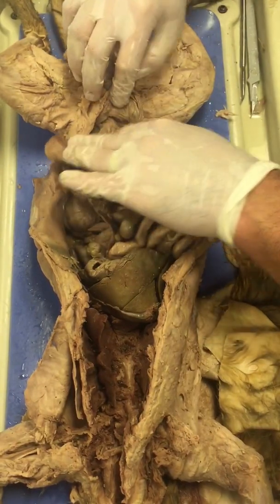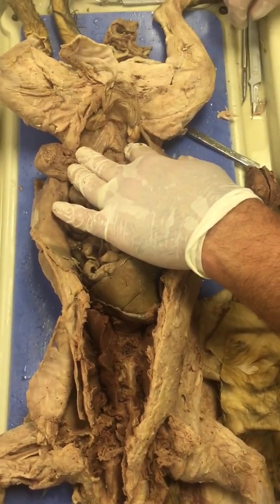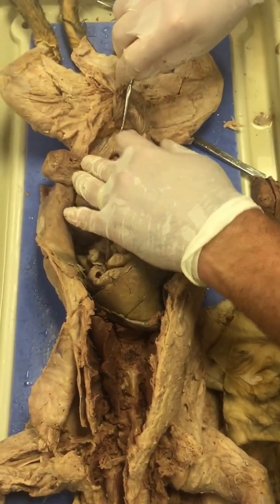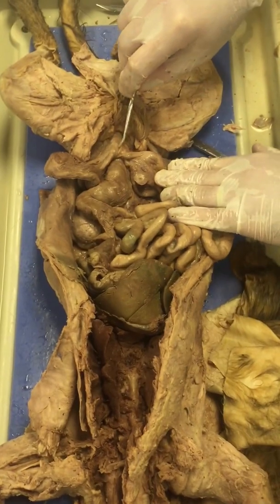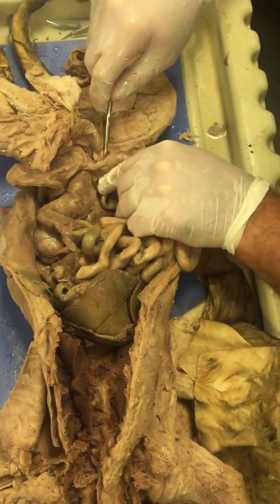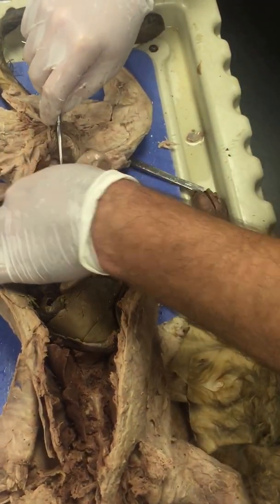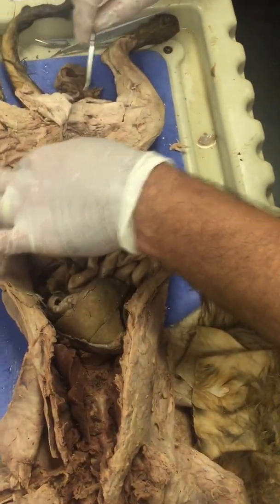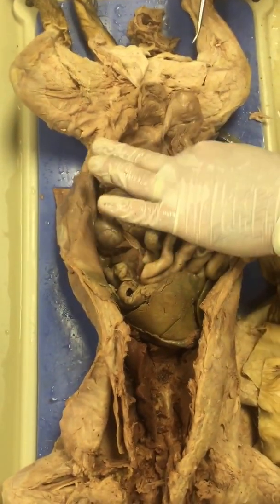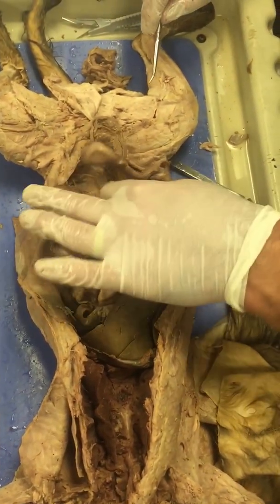So underneath the bladder you can see the uterus right here. This is a lot more pronounced because the cat's pregnant; on the one that's not pregnant, this is a lot smaller. But this is the uterus, and then the oviducts or fallopian tubes go up here, and you can see each little projection is where a developing embryo is located.